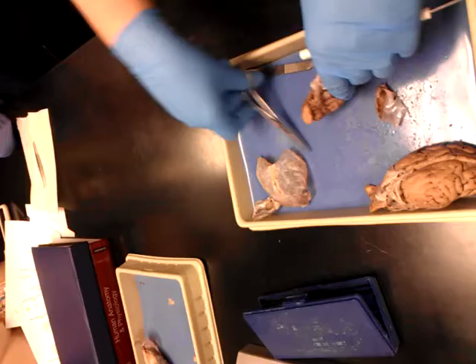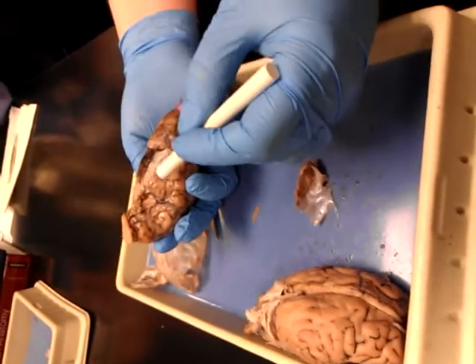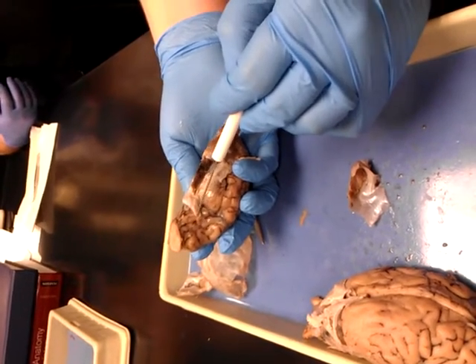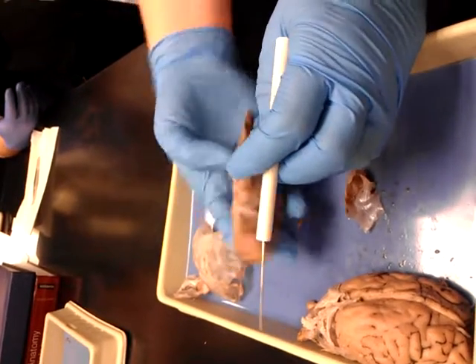Let me try and get behind your cranial nerve here. So that's cranial nerve number one, your olfactory bulb, and see how this is like a V, part of a V — the other half is on theirs. This is your optic nerve, cranial nerve number two. And those are the two you have to know on the dissection.